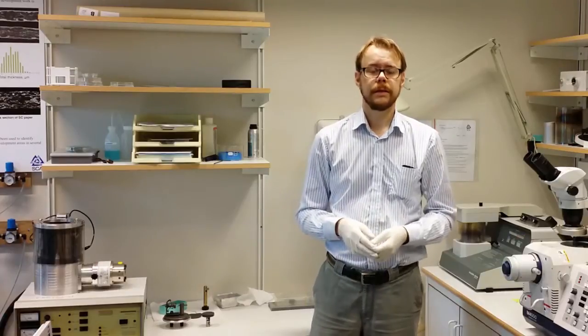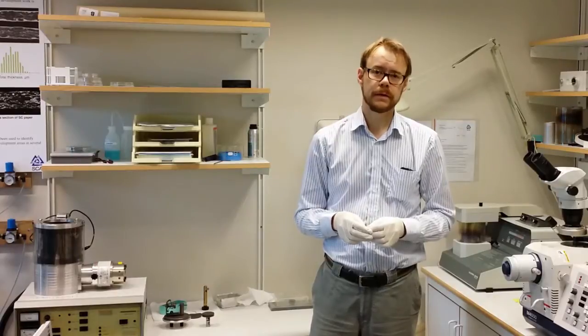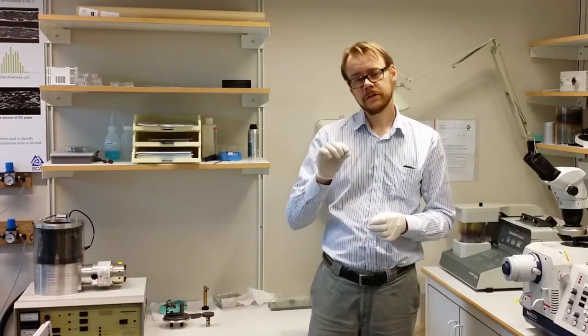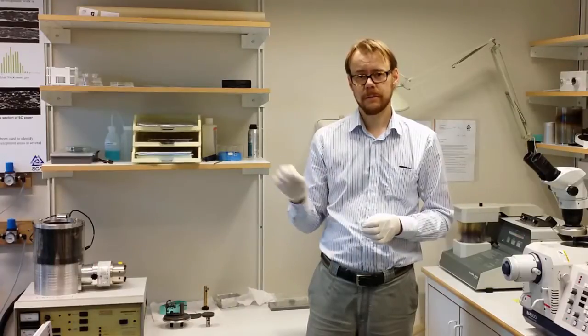Hi! The final step required before you can do electron microscopy on your sample is that you put an electrically conducting thin layer that coats the surface of the sample.